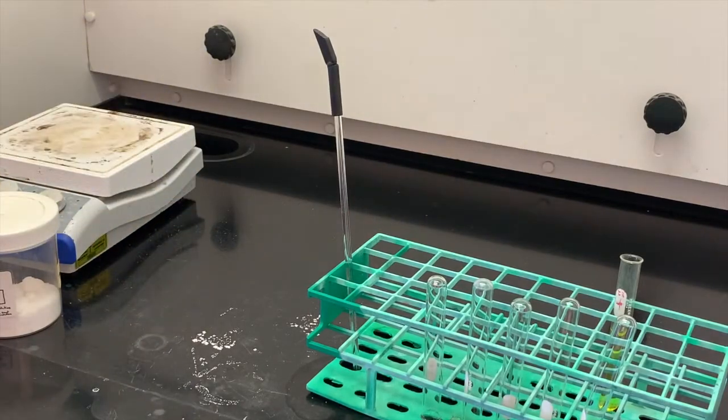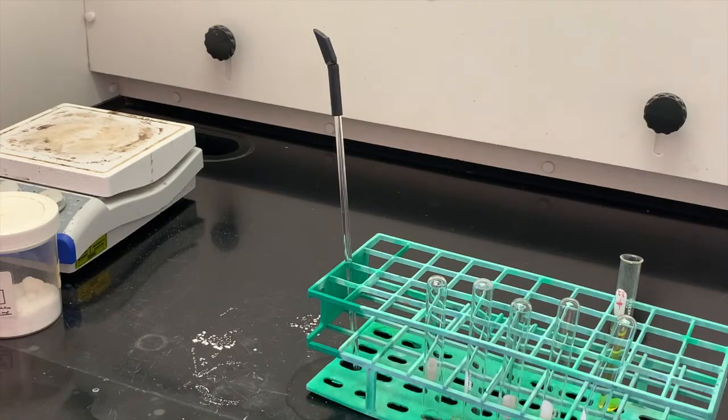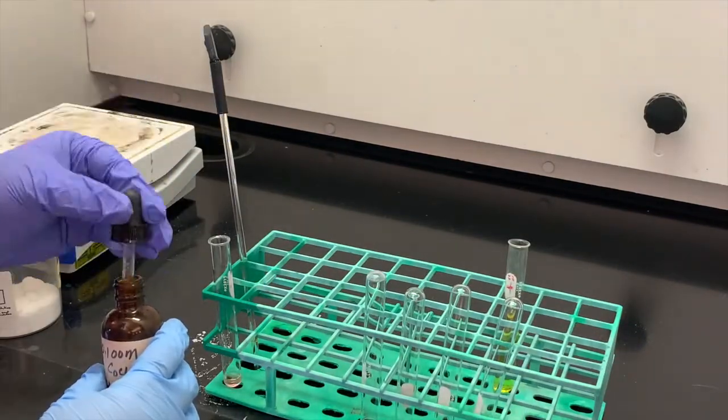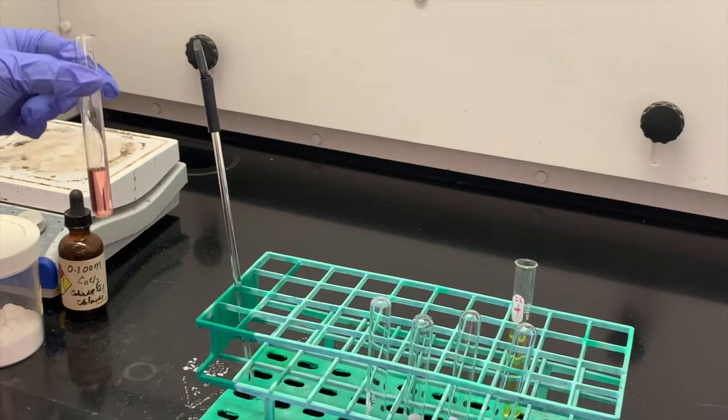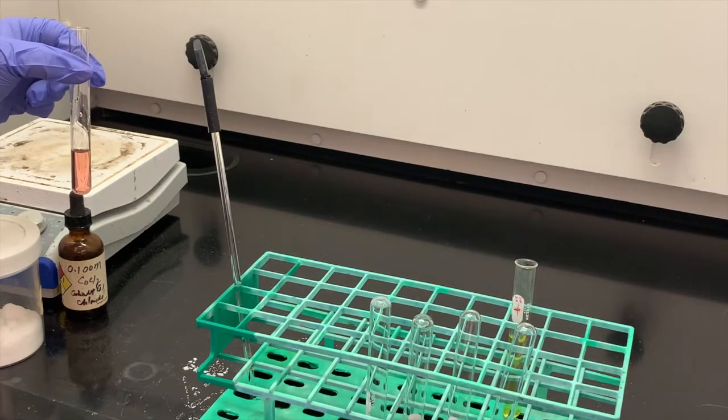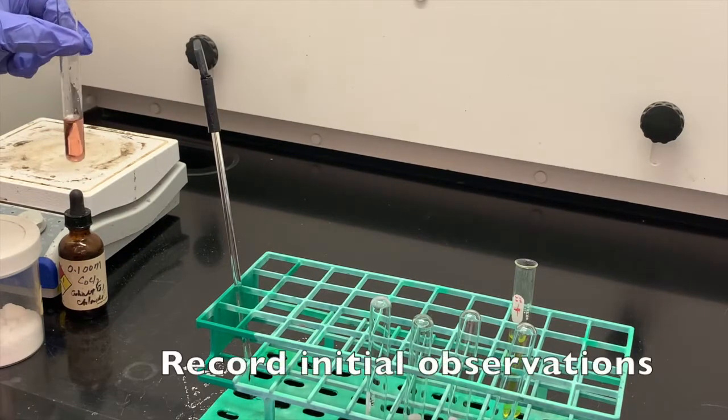I'm just going to set these other chemicals aside. Okay, so I have my cobalt-2 chloride in my test tube.